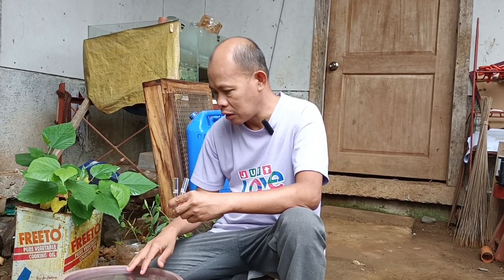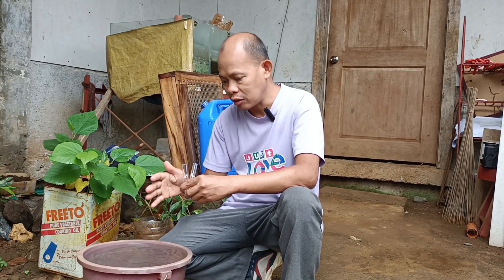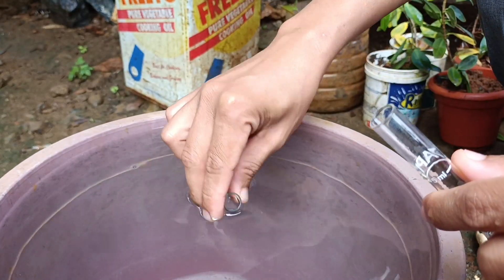We are going to check the water pH because maybe it's the acid rain that caused the guppies to die in my outdoor pond. Some of my guppies in my outdoor pond died because of the rain. Yesterday it rained until now it's still raining and some of my guppies are dying. So now we are going to check the pH of the rainwater that I gathered last night.